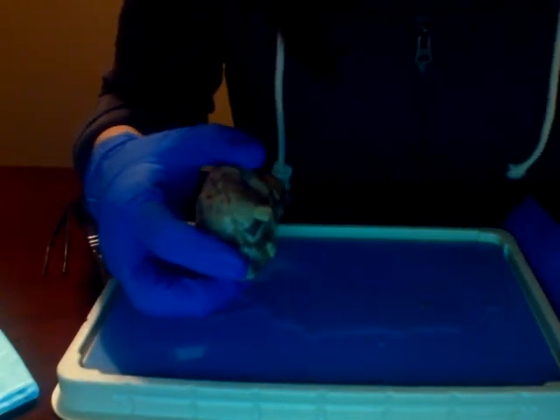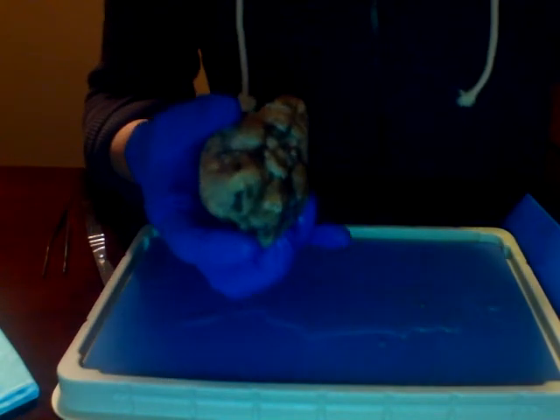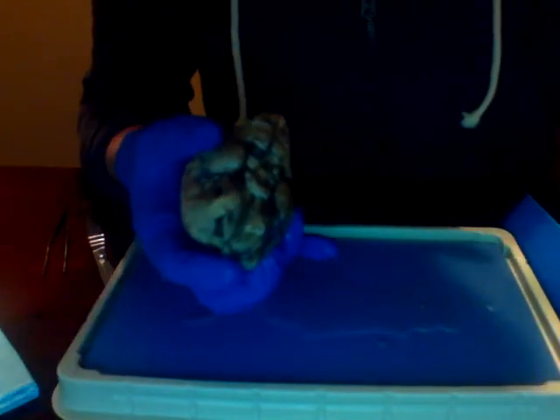Sorry, I got all my stuff mixed up. I got sheep juice on everything.